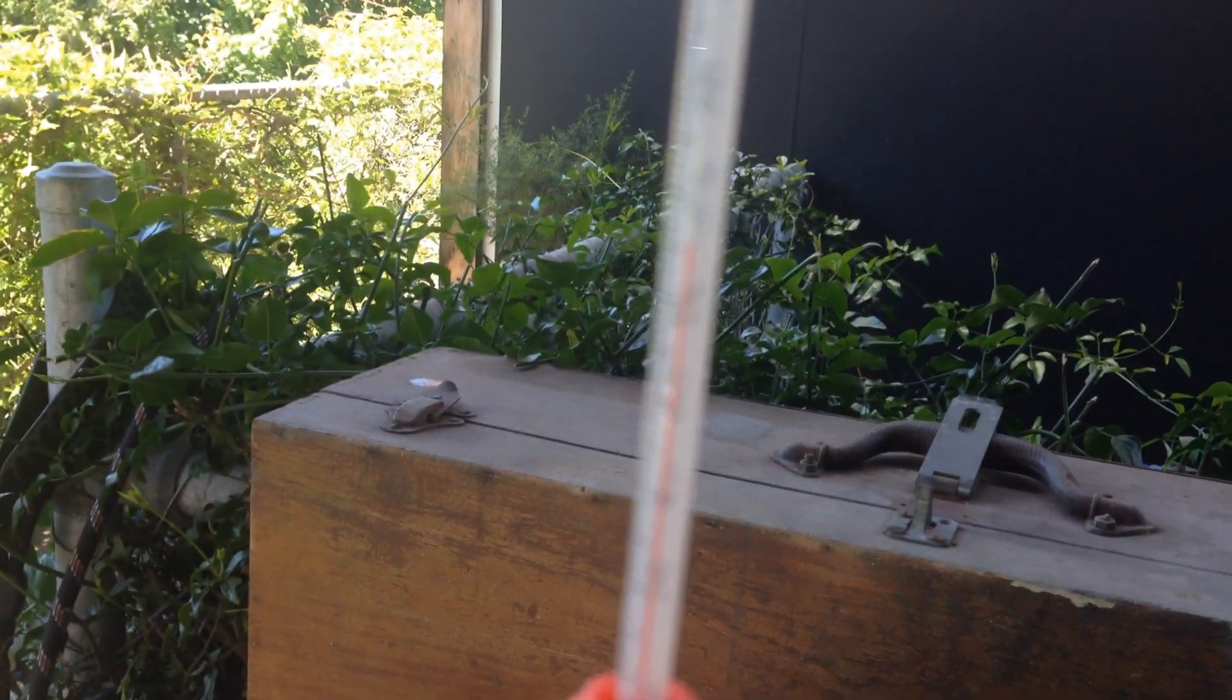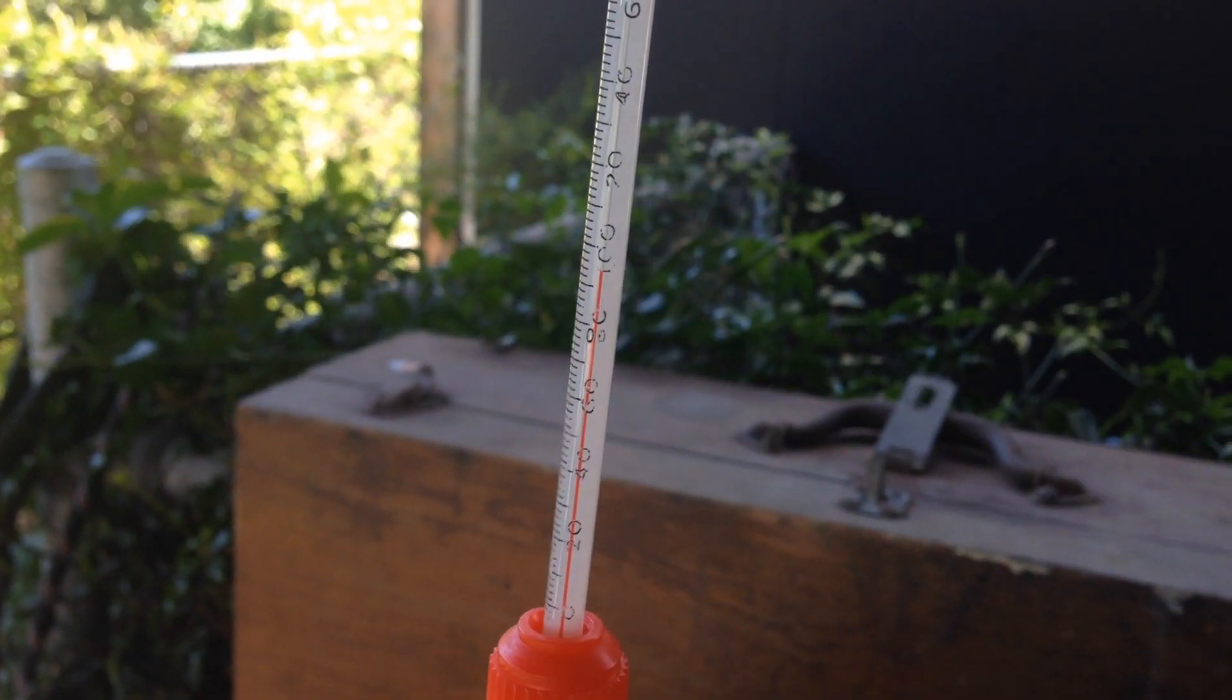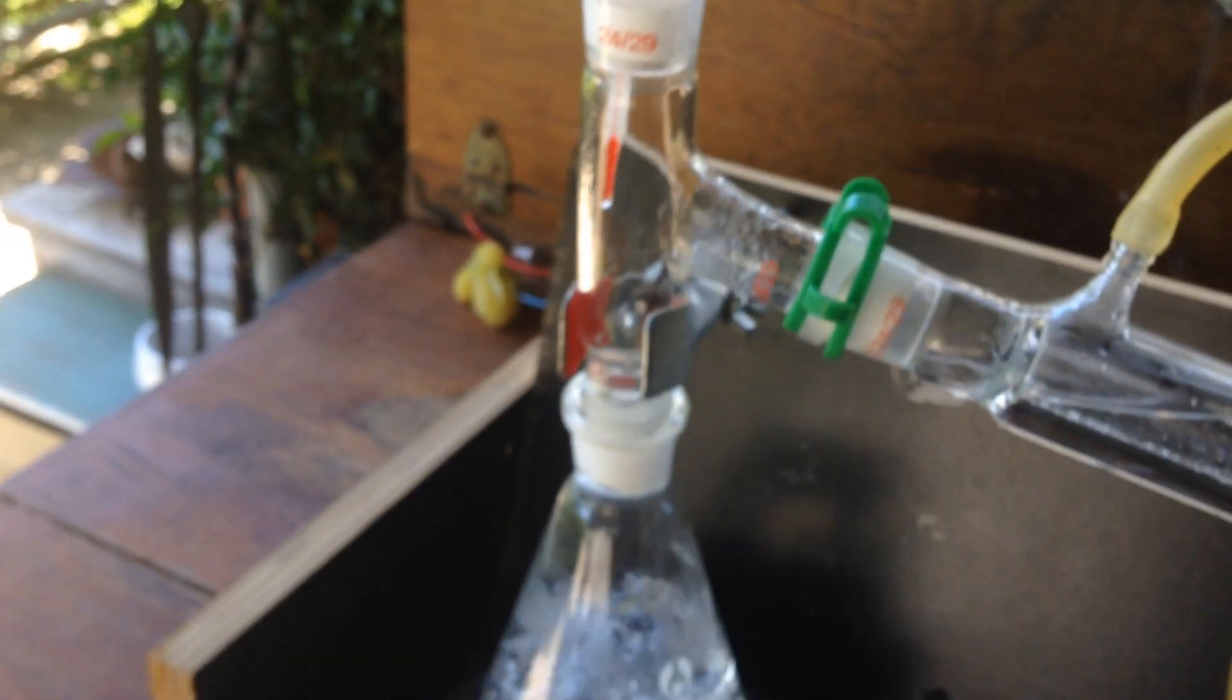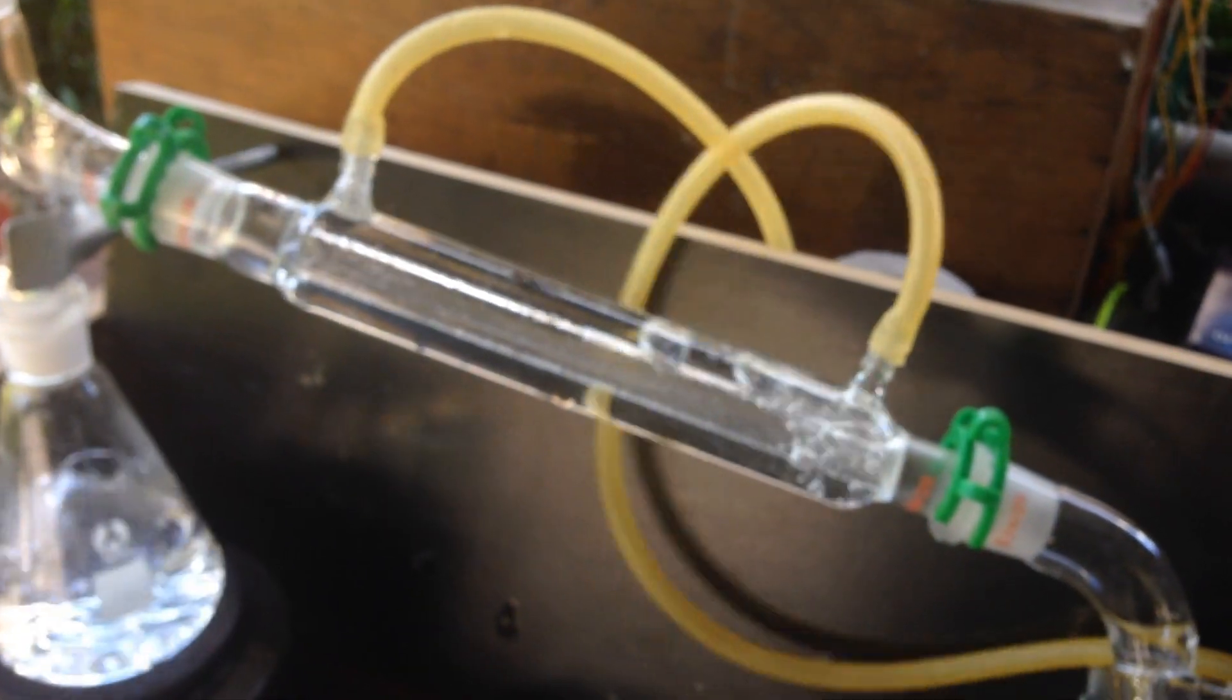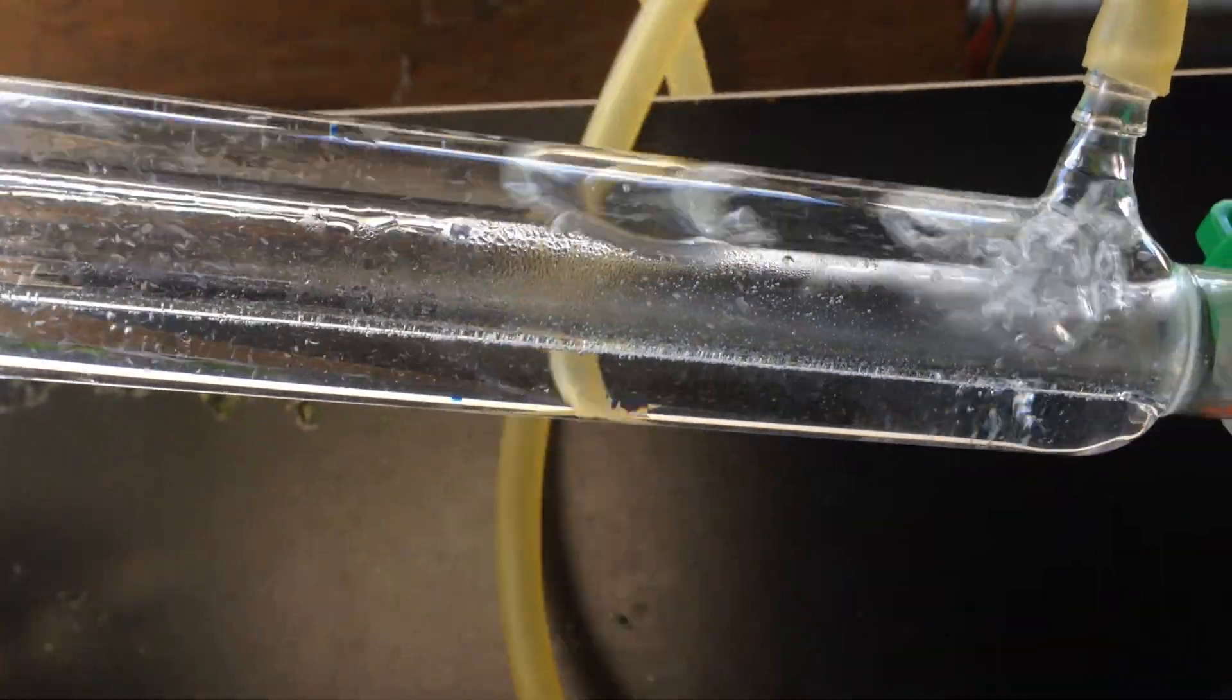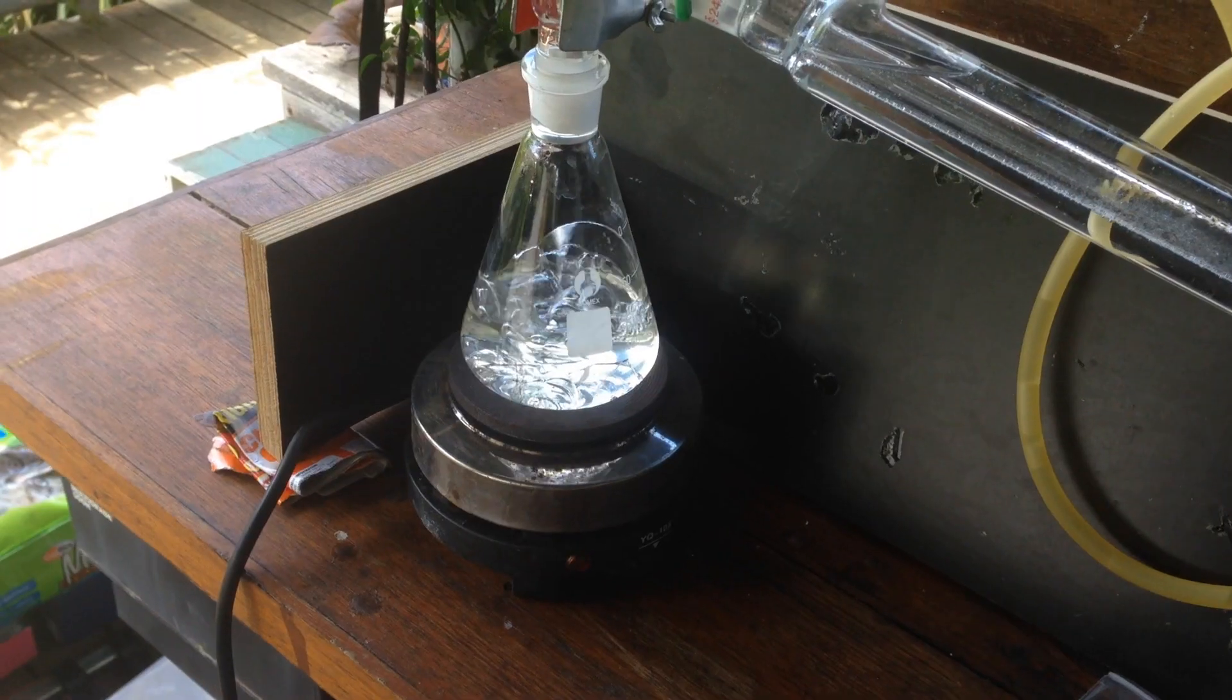The steam is now just about making it over. You can see, if it'll focus on the thermometer, there we are. We've nearly got 100 degrees, so all those vapours are pretty much travelling over now. So, I'll turn on the pump, and you probably can't see, but we are condensing our water through that tube.